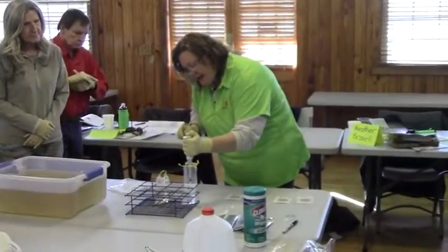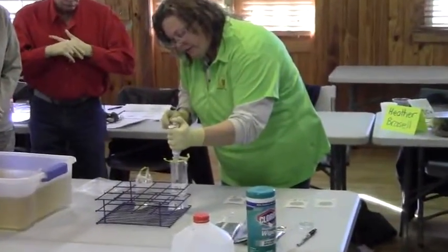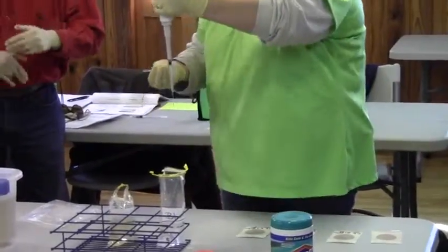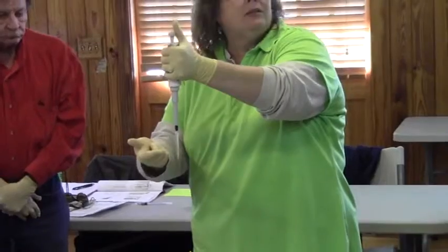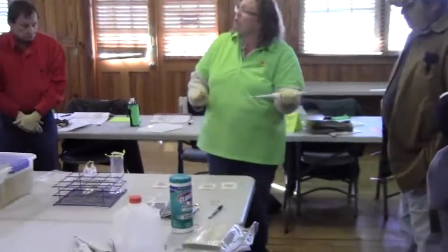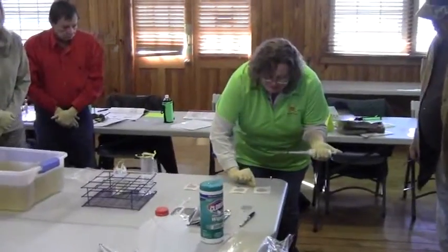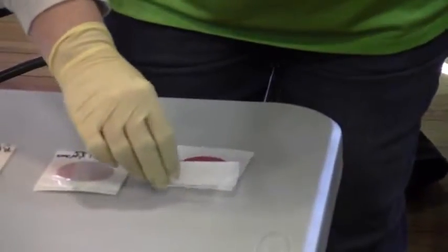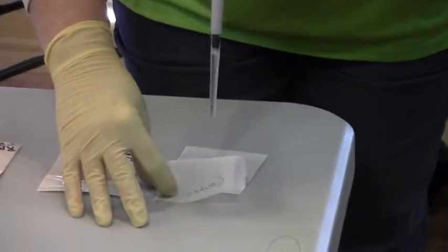Then you're going to stick it in the bag, let go, and it's going to draw it all the way up into there. You don't want any air bubbles in it. So you take that, take your control, lift up the top. Now, you don't want to go down really, really close and plunge it all at one time, because the medium on here will go everywhere.